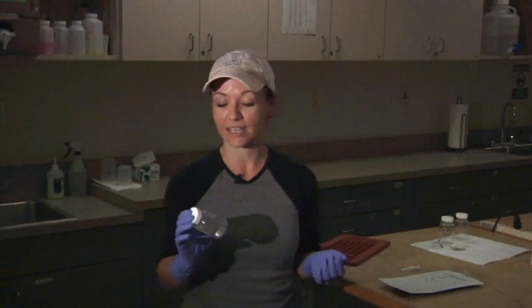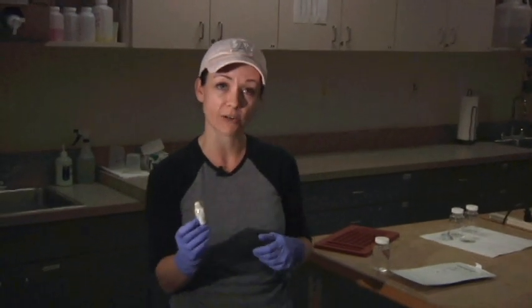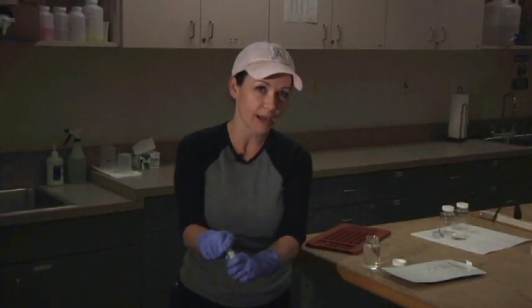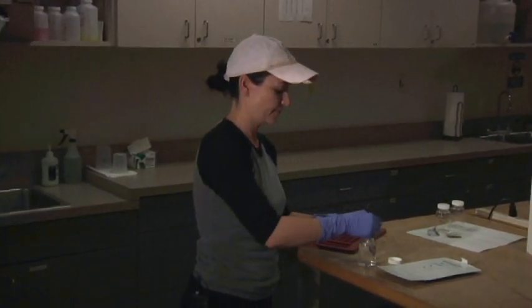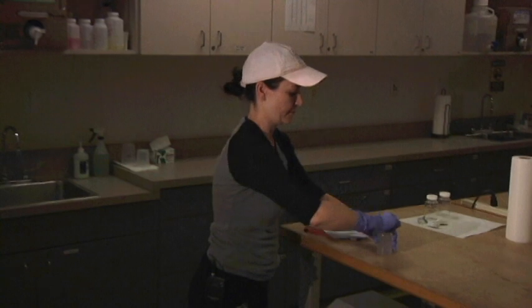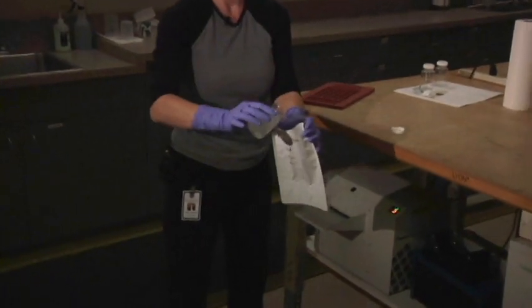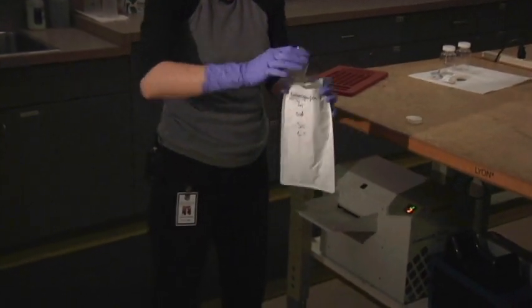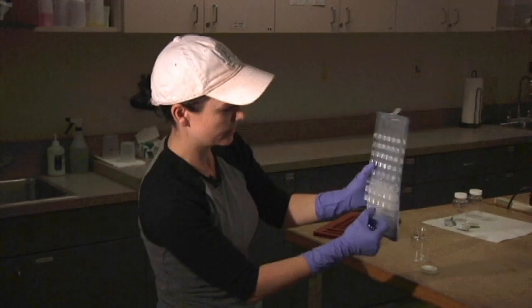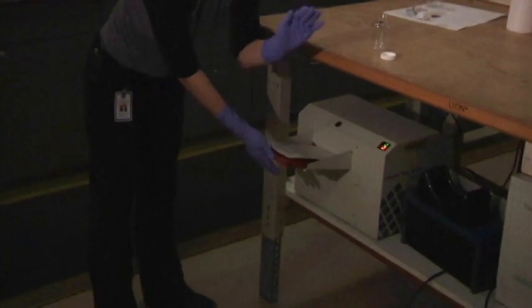We're back at the lab now after sampling at a stream and we collected our E. coli sample. We're going to add some special powder to the bottle — if E. coli is present, the bacteria will eat this powder and it will make them fluoresce. Then we add the sample to this tray and try to keep it sterile so we don't touch inside. We take out all the bubbles, then add it to the sealer, and that's going to make sure that the sample is evenly dispersed among those cells.